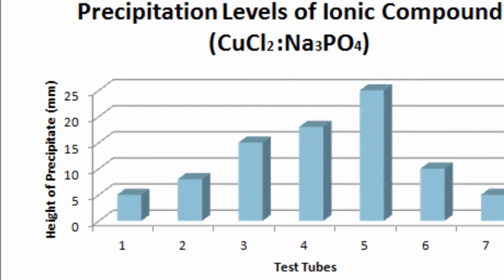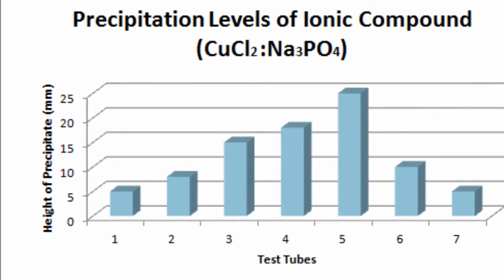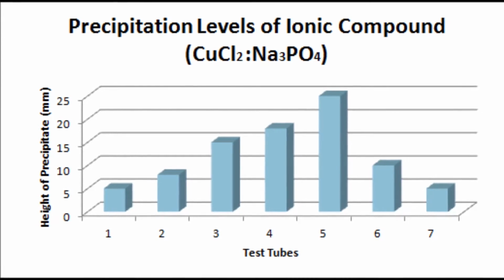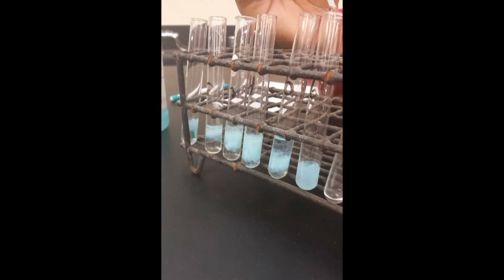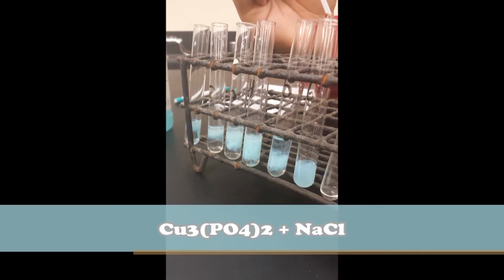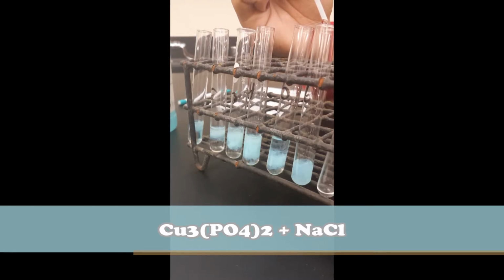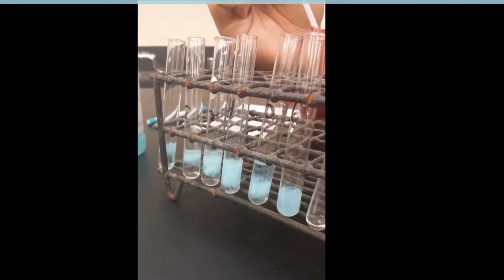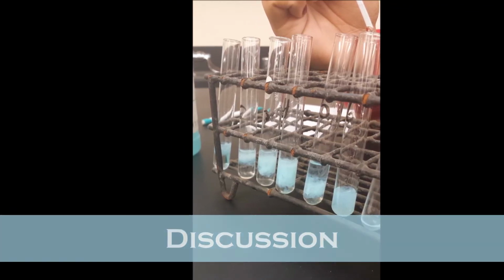We concluded that test tube number 5, having a volume ratio of 3 to 2, had the highest amount of precipitate, 25 millimeters, after sitting for 10 minutes undisturbed. From observing the information, we found the formula of the products of the combination of the two solutions to be Cu3(PO4)2 plus NaCl, Cu3(PO4)2 being the insoluble precipitate and NaCl being the soluble part of the solution. After analyzing the recorded data, we concluded that test tube 5 had the highest height of precipitation with a ratio of 3 to 2.